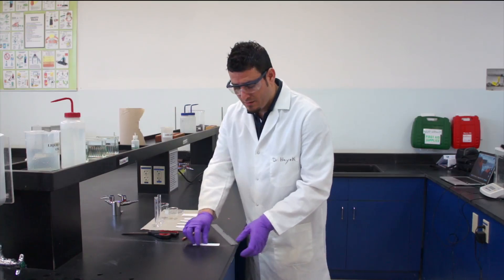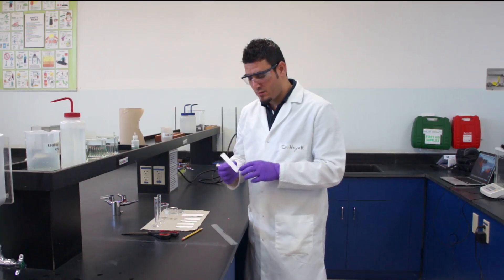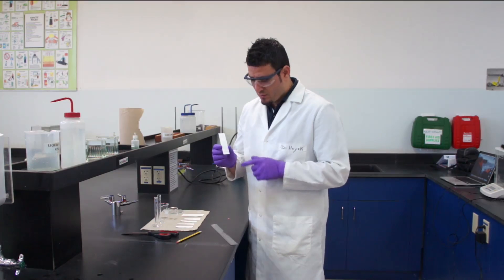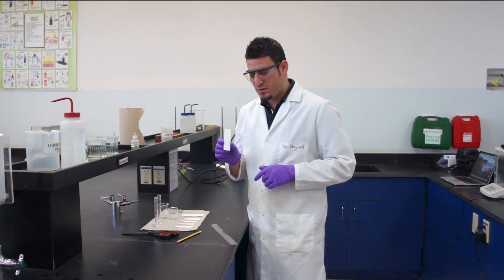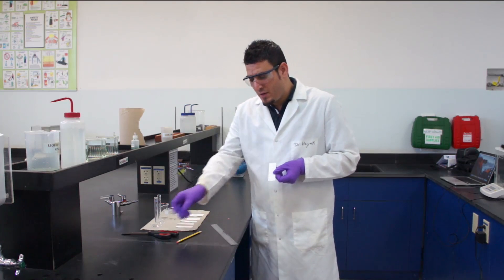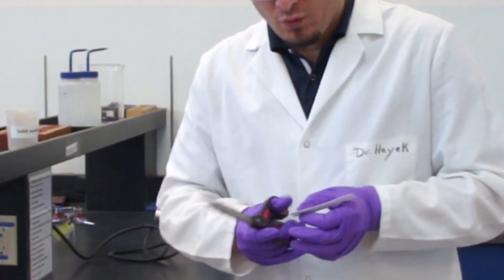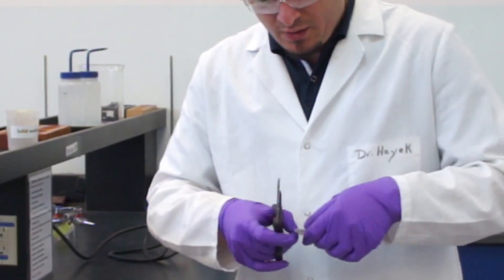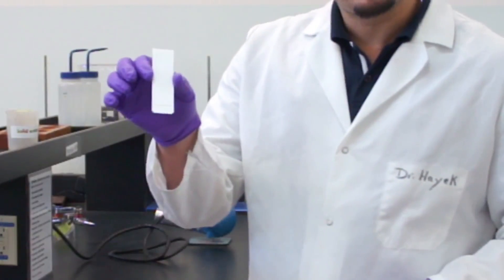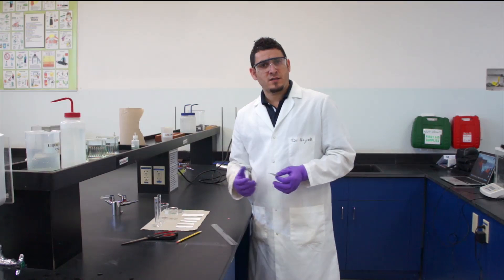We draw a tick in the middle of the starting line to mark where the mixture will be placed. To ensure the solvent runs straight up the paper, we cut small notches at the corners of the paper. This is how the paper will look after cutting the small corners.